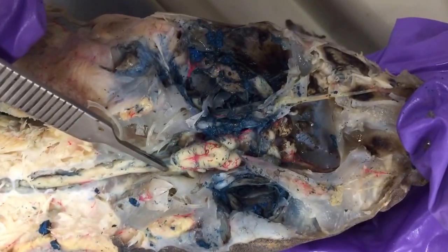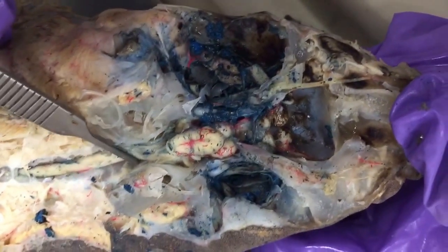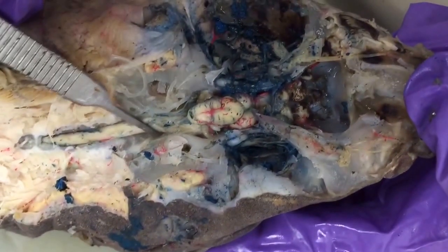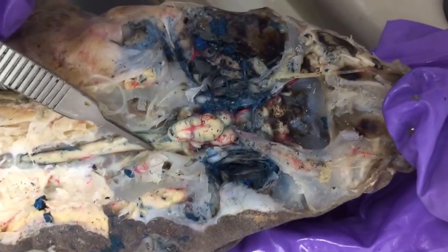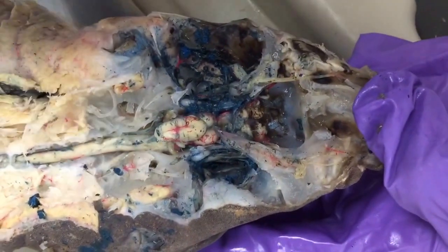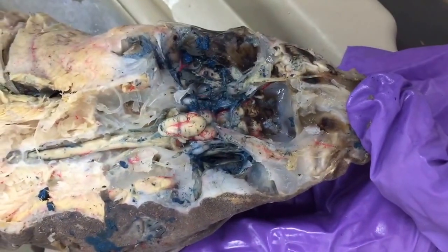and branches off higher up on the medulla oblongata, and then the vagus nerve, V-A-G-U-S, branches off lower down, and I kind of accidentally pushed it off of the medulla oblongata, but it branches off lower down here and is a little thicker than the glossopharyngeal up here. So I've got the glossopharyngeal and then the vagus nerve branching off lower down on the medulla oblongata. Those are the only nerves we're going to know. We're not going to learn the various branches of the vagus nerve further down here.